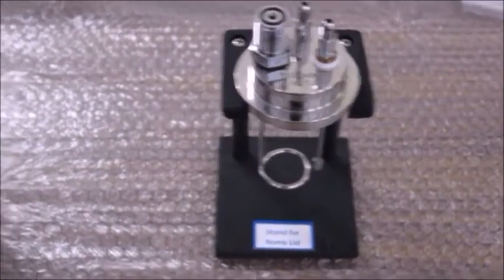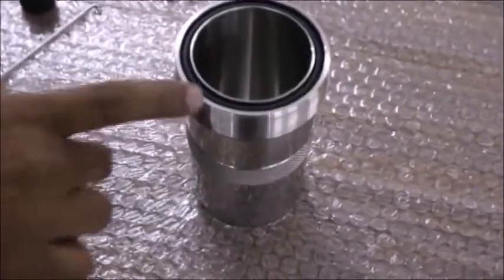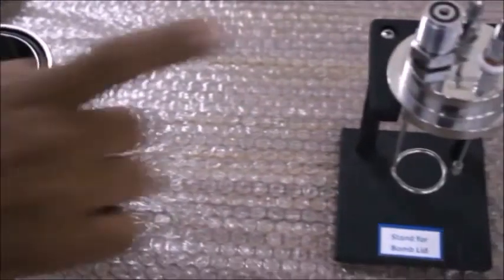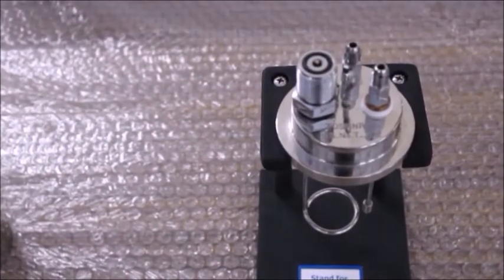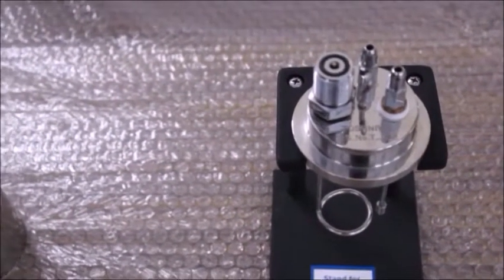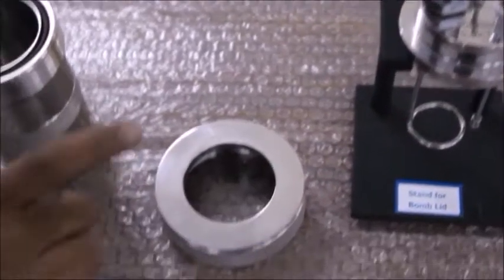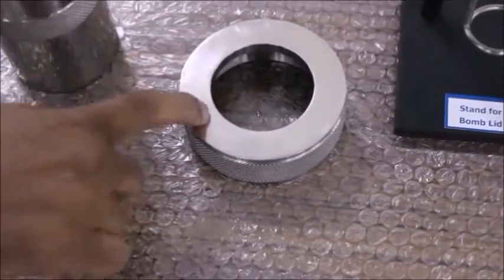The bomb lid and the bomb body are entirely made up of SS316 grade for superior quality. The bomb ring is made up of stainless steel 304 grade.